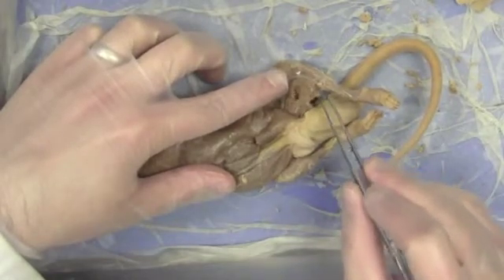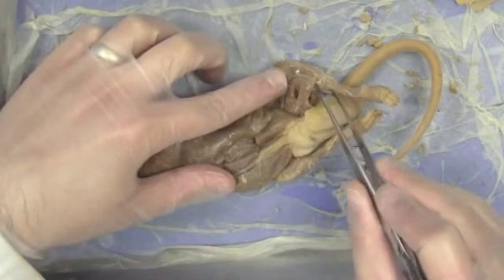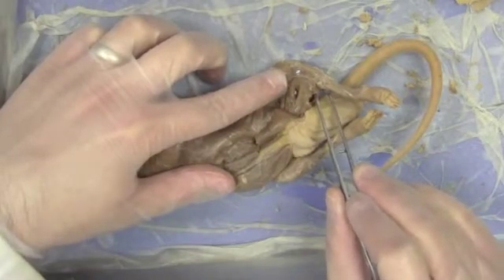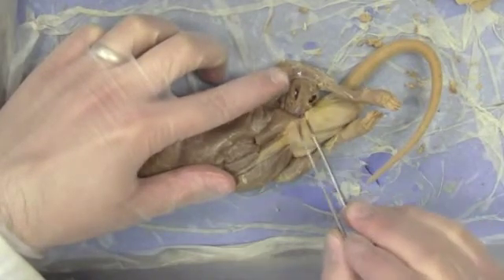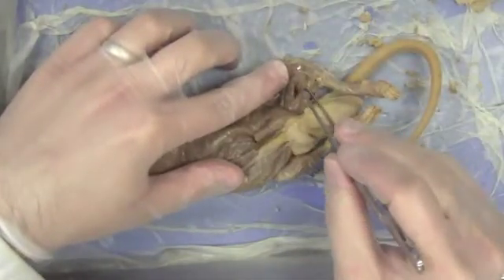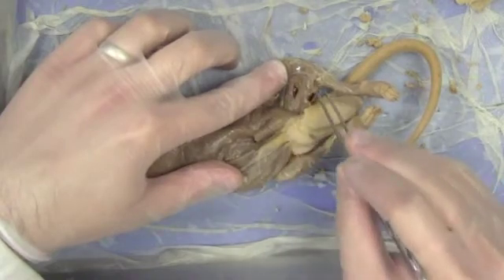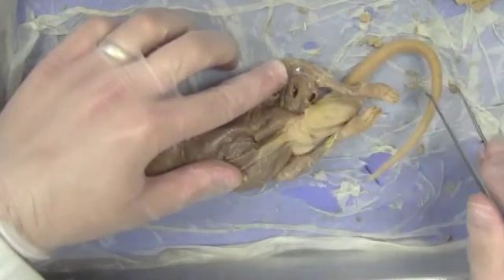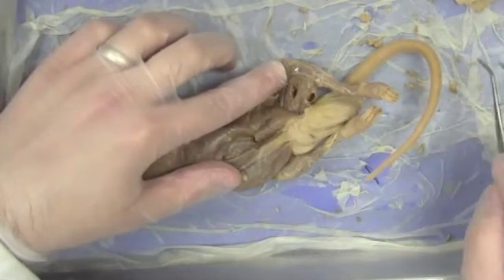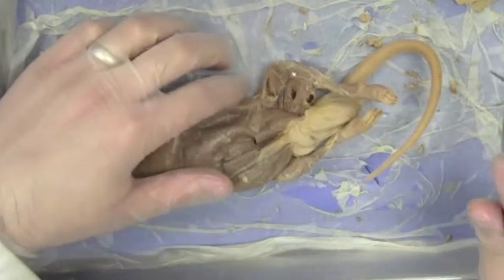Also on the inside here, clear to the back, I can pull off a little piece of the semimembranosus. I was able to see the semimembranosus from the outside and from the lateral surface as well. Now if I take the semitendinosus, the semimembranosus, and the large biceps femoris which was on the other side of the leg, you'll recognize that those are the three muscles that make up what we collectively call the hamstrings group.